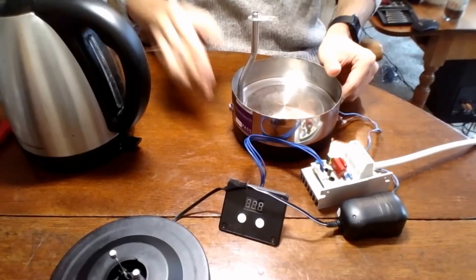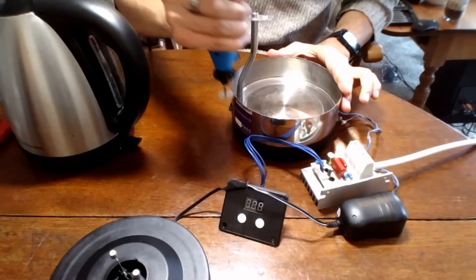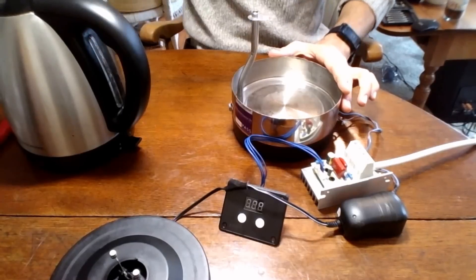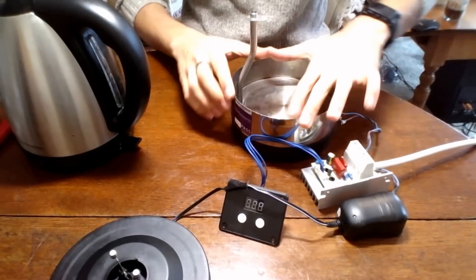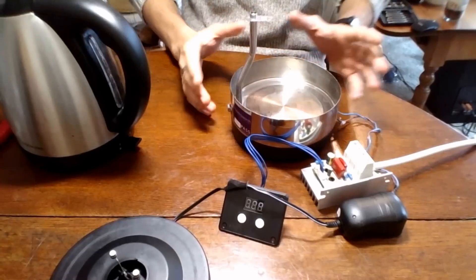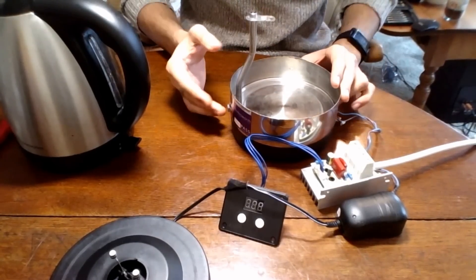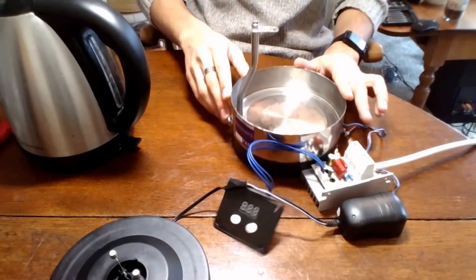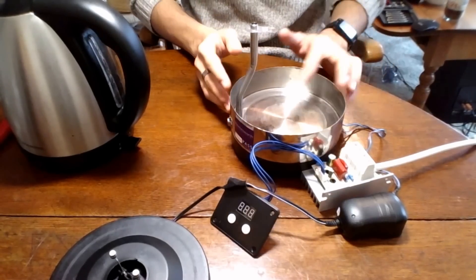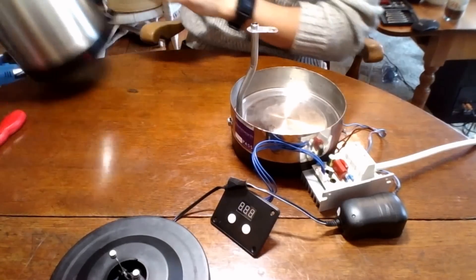After I did that, I used my Dremel, and using a cutting bit, I went all the way around the edge, and cut a wall maybe about an inch and a half high, just so I can have some sort of a fluid in there when I'm heating, whether it be mineral oil or water, so the heat has somewhere to go, because otherwise we might end up damaging the metal or the element, which is not a desirable outcome.